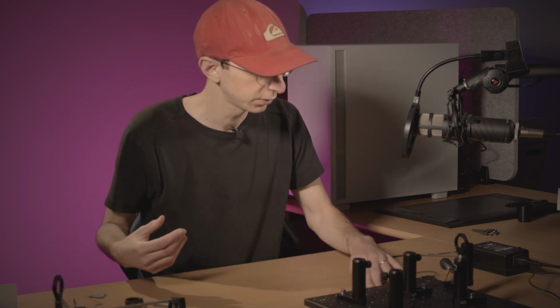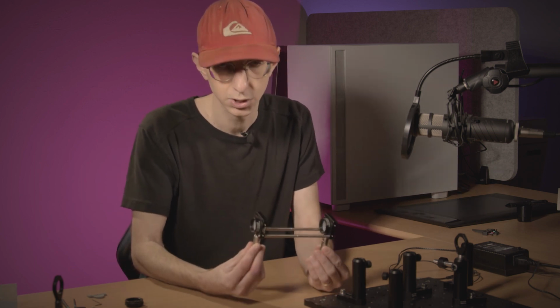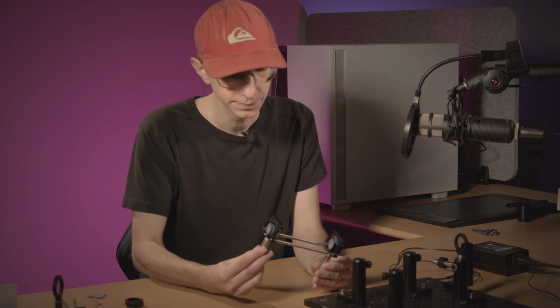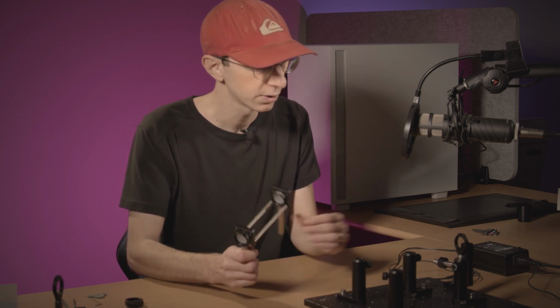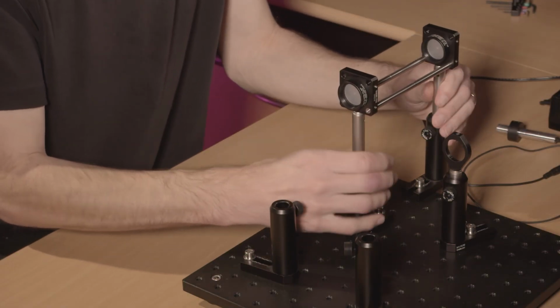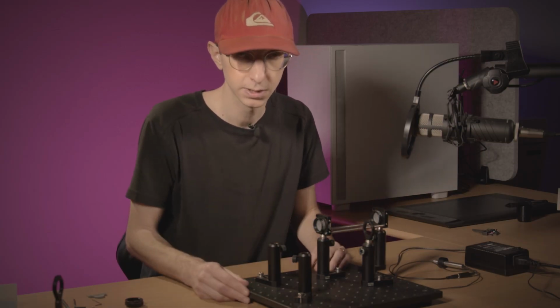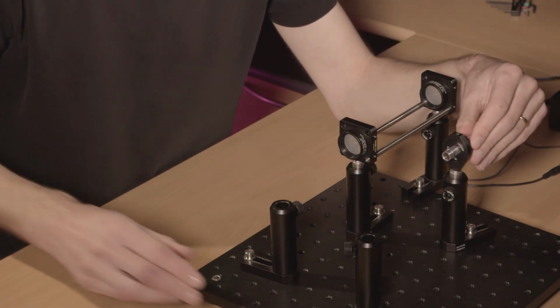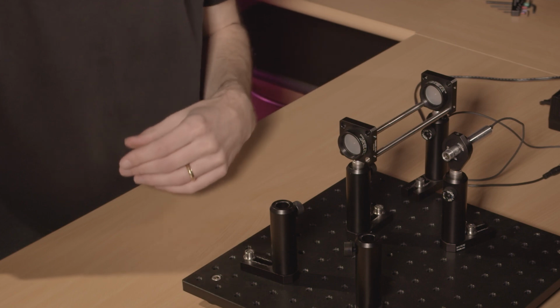So just like for the barbecue skewer, I will use two apertures to define in space the orientation and position of my laser. These apertures are frosted glass discs so that I can clearly see the laser beam, and they have a 1.5 millimeter hole at the center. So how do we do it in practice? I will set the aperture in place, and these will define the mechanical axis through which I want my laser to pass. Now I will set my laser. Okay, it's secured.